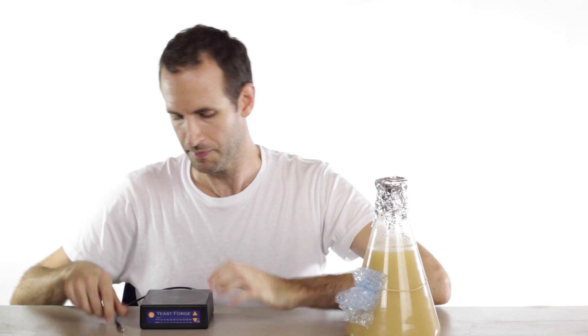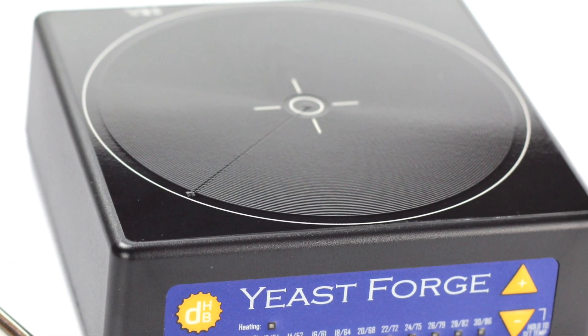Now the main new feature is the heating and that's what I'll show you how to use next. We've got an external temperature probe here and a gentle warming heater plate built into the top of the stir plate.